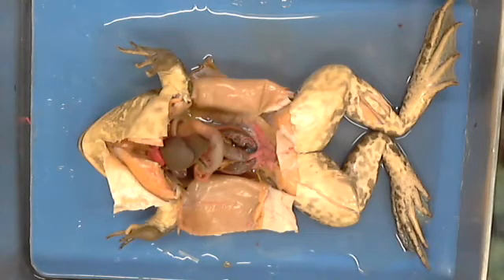Circulatory, respiratory, digestive. Basically all of them. So he has circulatory because of lots and lots of oxygen intake that comes in through the skin that's there. He's respiratory because he's breathing in it, and he's digestive because he eats with it. So same thing for you and I, outside of really the ideas of circulatory. It's not as significant for you and I in the mouth, but for him, it's all the above.